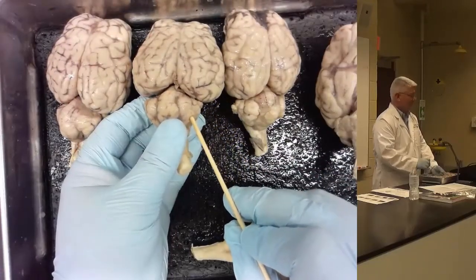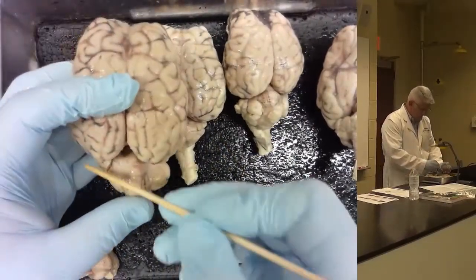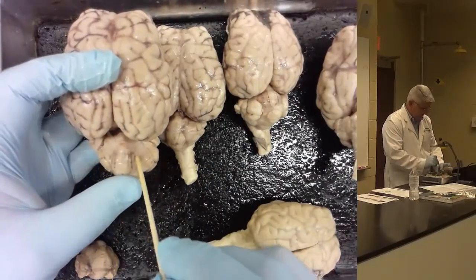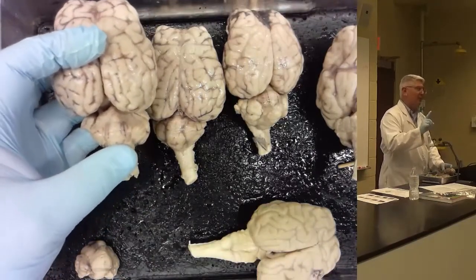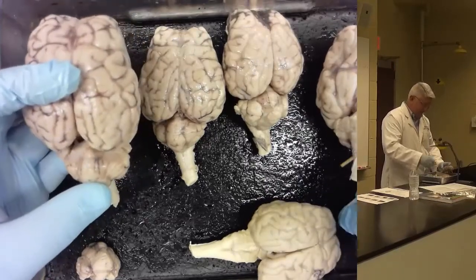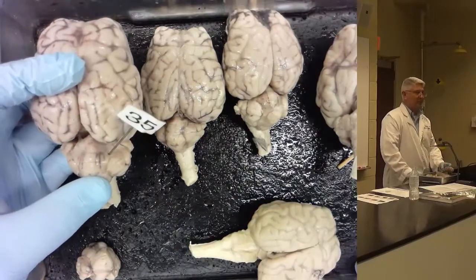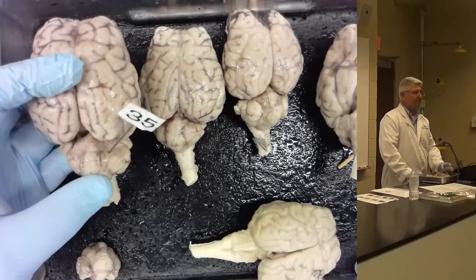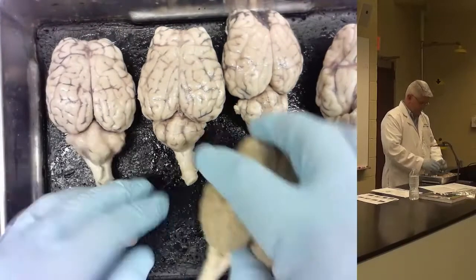Can you point out the fissure prima? Yes, let me show you this one. So it's a fissure that runs across the brain here. It's usually most prominent through the vermis, but again, it's the only fissure or sulcus in the cerebellum. So if you have a pin that's stuck in the cerebellum up here and it says fissure or sulcus, it has to be fissure prima. Okay? It has to be fissure prima. Almost done.